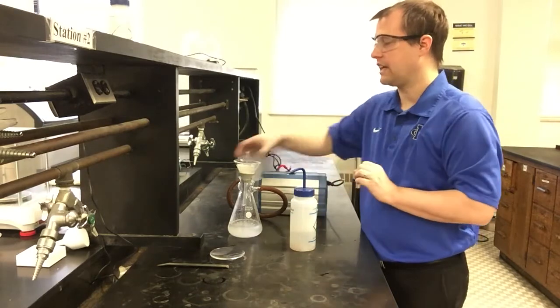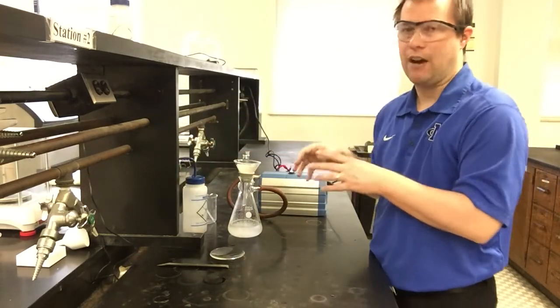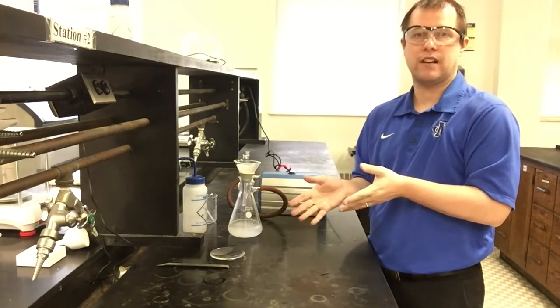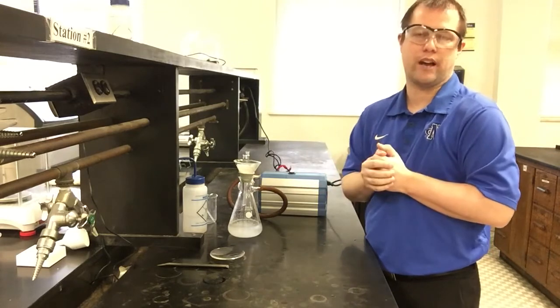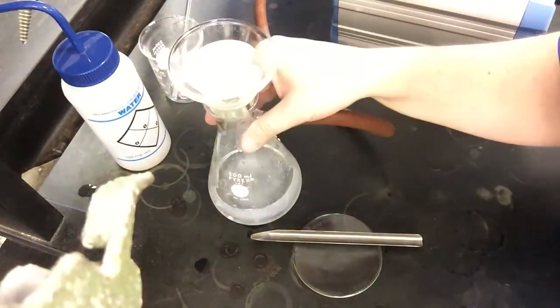And so now it's just a waiting game. I'm going to let this finish draining. I'm going to cut this here for a second. I'll show how I go about removing the filter paper and getting it spread out on my watch glass, and then I'm going to go ahead and dry it. I'll show you the dried product and the final mass in a final clip. All right, so the filtration's pretty much done at this point.